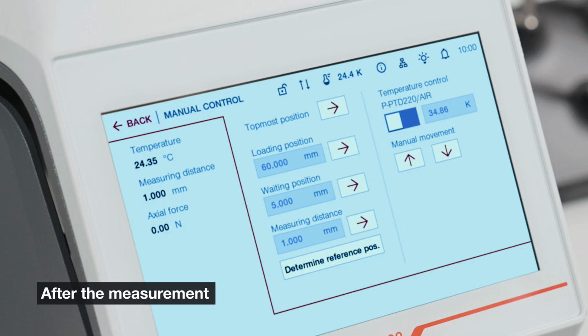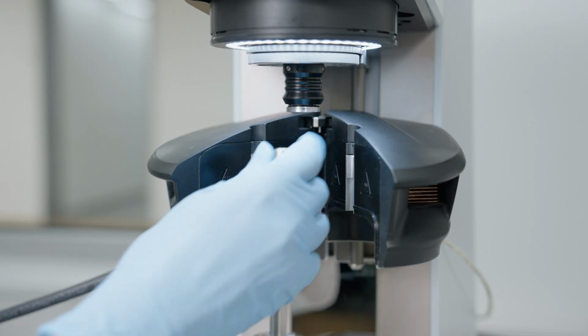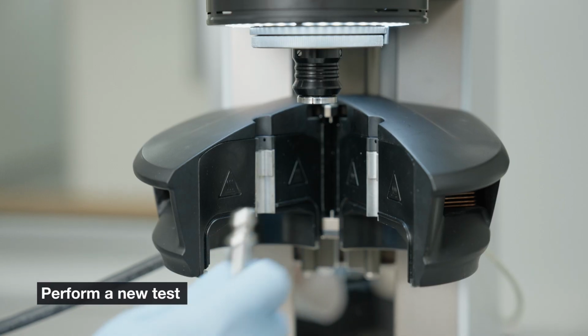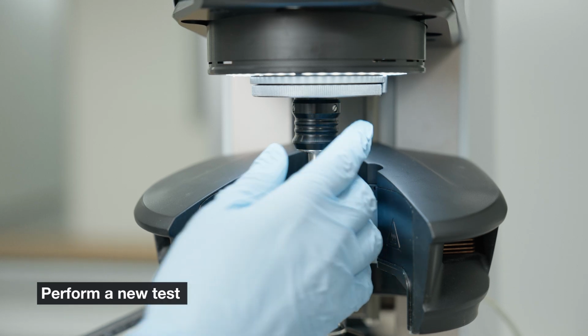Open the control panel and click Topmost Position. Remove the measuring geometry. Clean the measuring geometry and lower plate with suitable solvents. Connect the measuring system. Apply a fresh sample, go to the reference position, and start a new test.